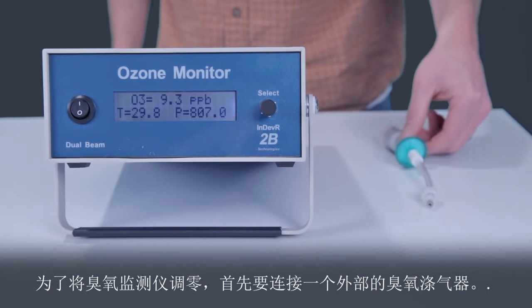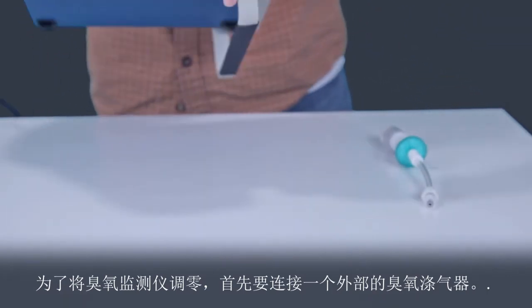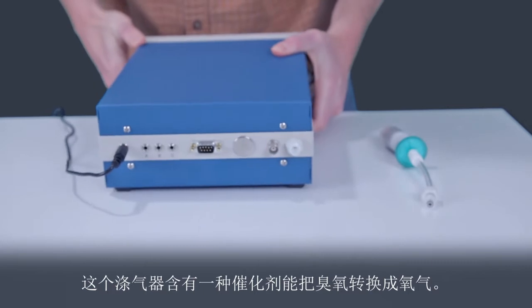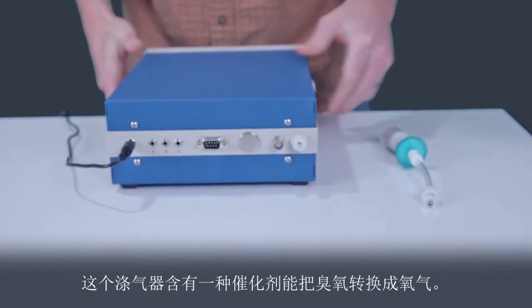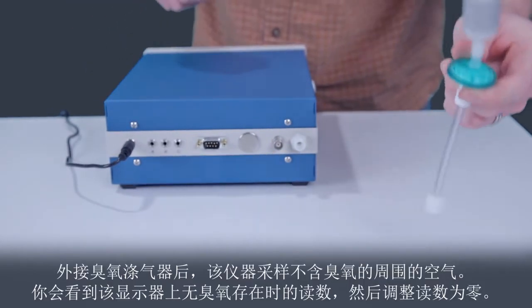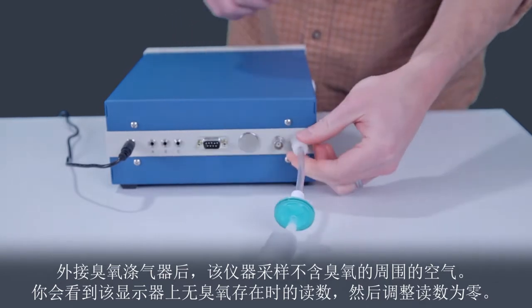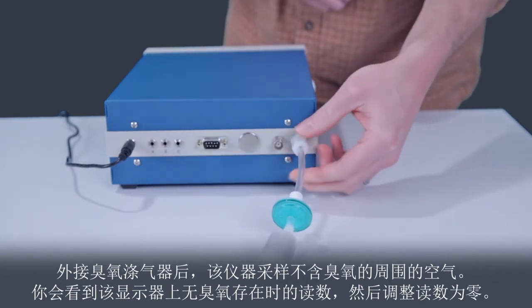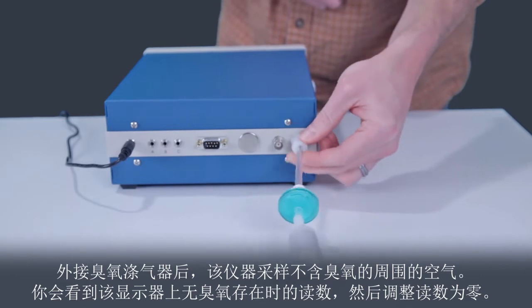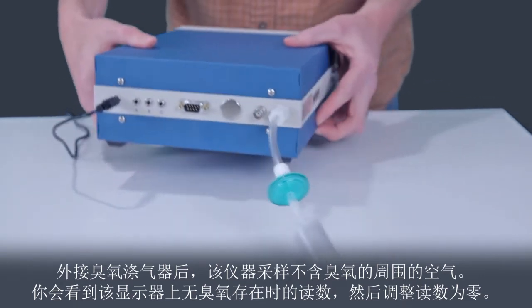To zero the ozone monitor, first attach the external ozone scrubber. This scrubber contains a material that catalytically converts ozone into molecular oxygen. With the ozone scrubber attached, the instrument samples ambient air that contains no ozone. You will see what the monitor reads when no ozone is present, and then just adjust it to read zero.